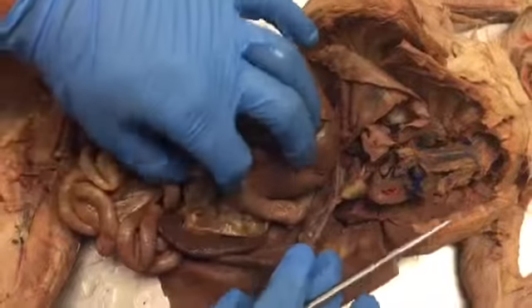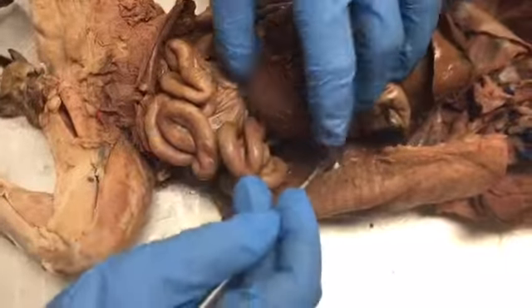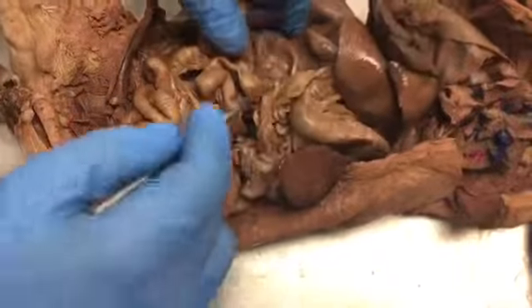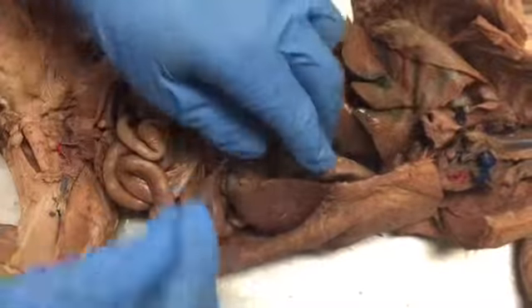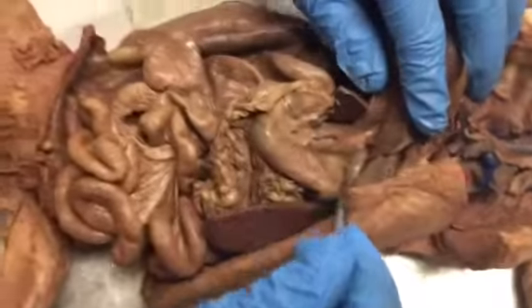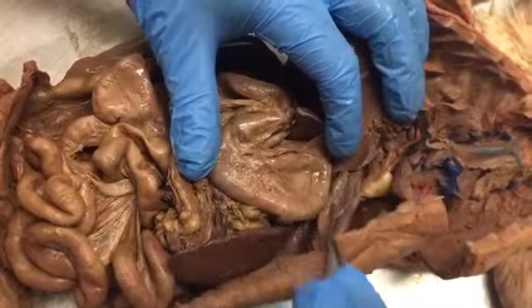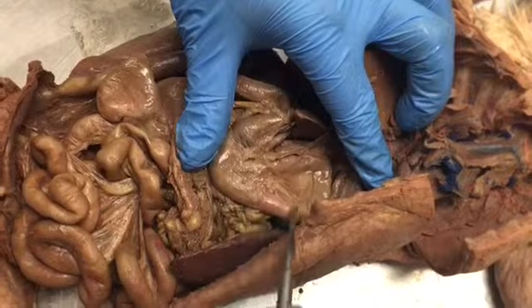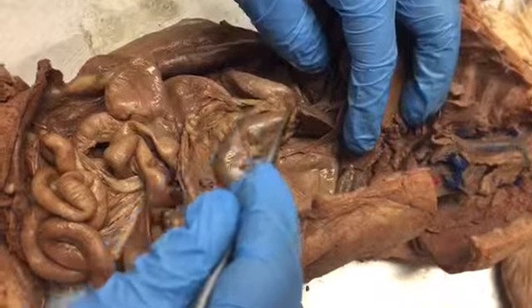The pancreas and the spleen. So first, for the spleen, runs right in through here. And then for the esophagus meeting the stomach. Esophagus meets the stomach right in here. And this is the stomach. So obviously we have the fundus at the beginning, we have the body of the stomach, and then the pylorus as it exits.